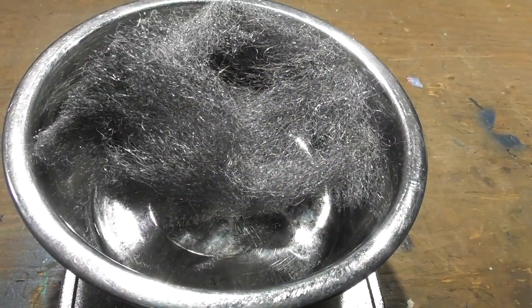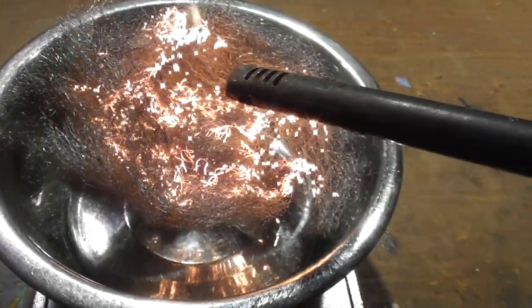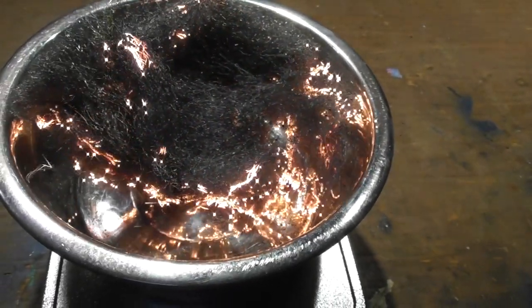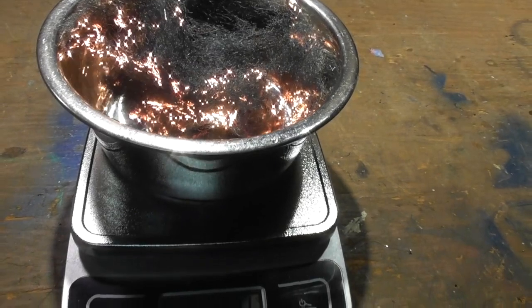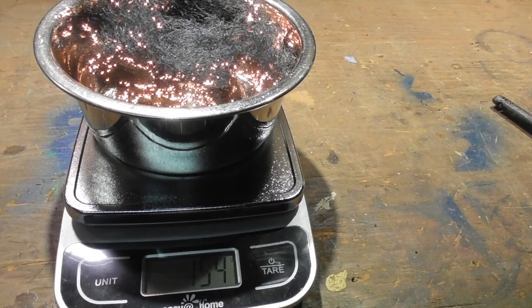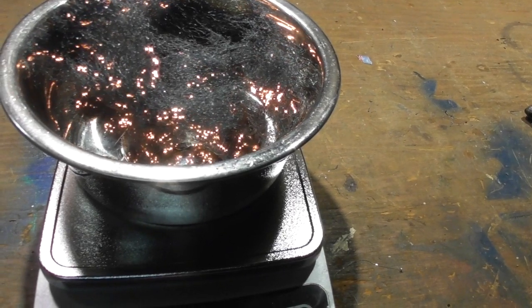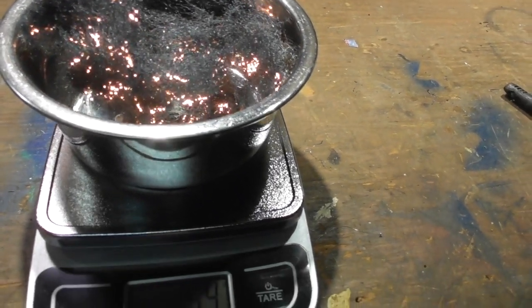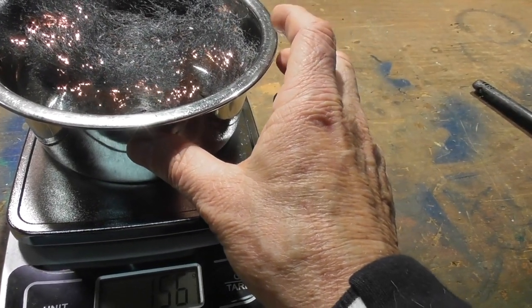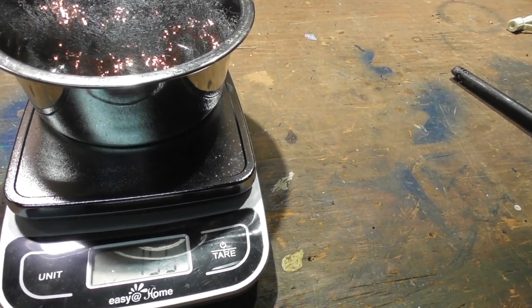Let's go ahead and light the steel wool and let it burn for a bit. While it's burning, we're going to very carefully keep an eye on the mass. Right now the mass is 154, and it's burning — kind of cool looking. We'll keep an eye on the mass; it is still 154. I'm going to move this back just a little bit so that you can see the mass.